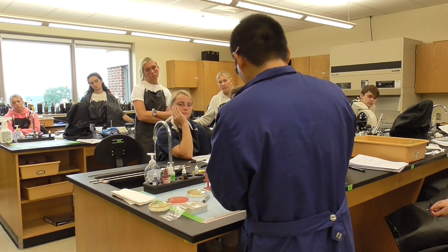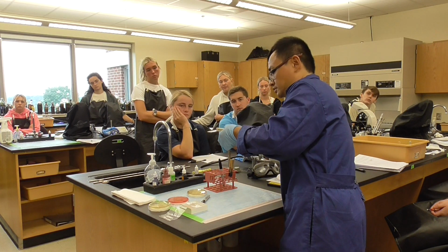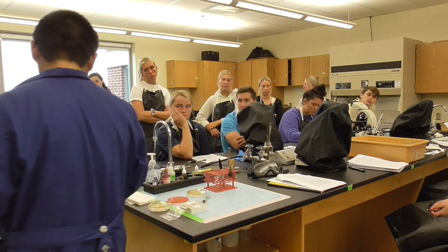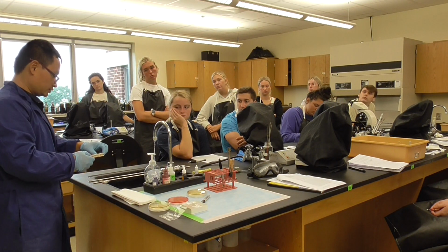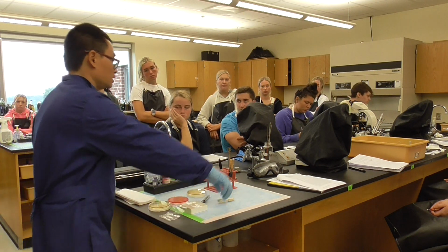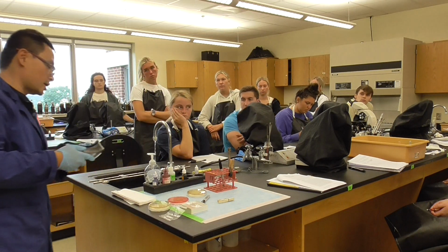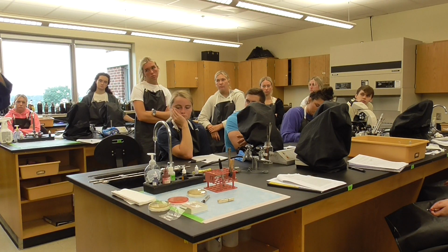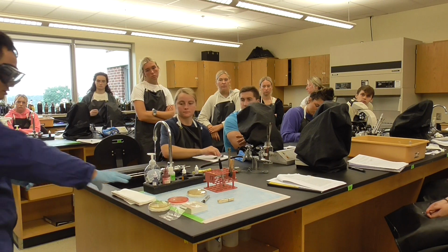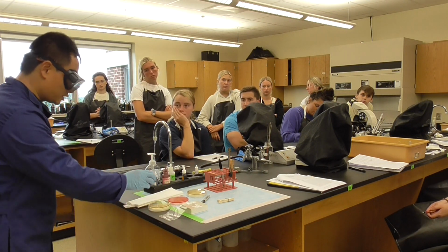Okay. After that, we're going to turn this off. Then cool down a little bit. Don't touch it on the side right now, because this might be hot. Okay, so we're going to put it right there. Now you have to wear the goggles, because we're going to touch the dye. The first time you do the Gram stain, you may not know the procedure very well, so I will suggest you just arrange it.